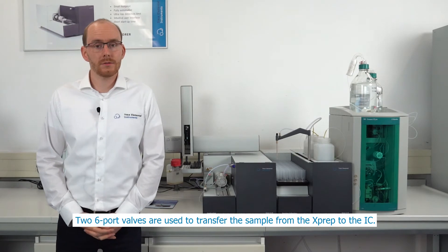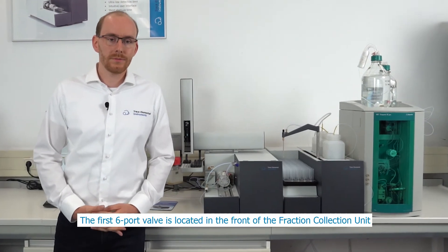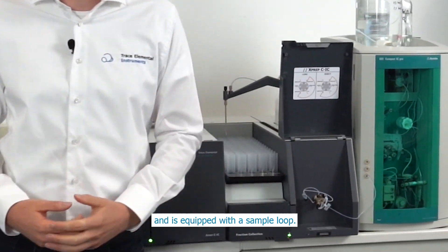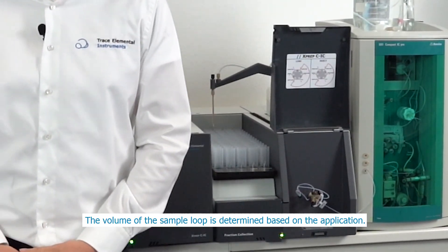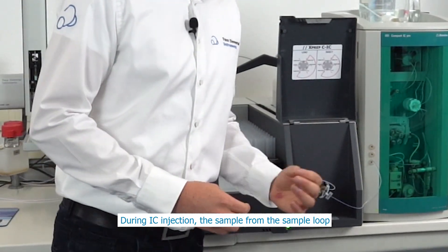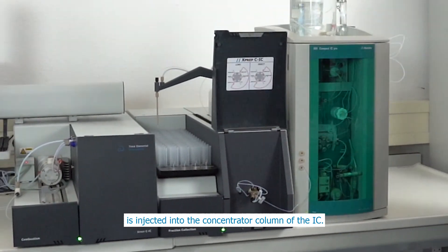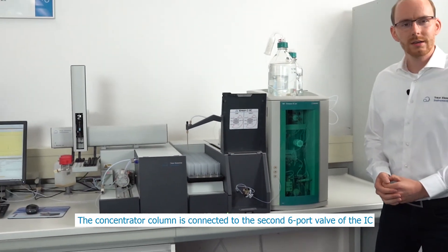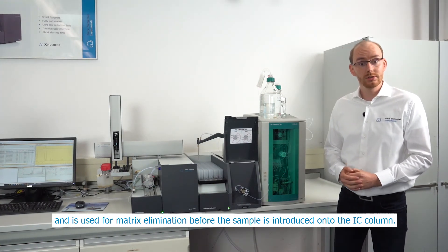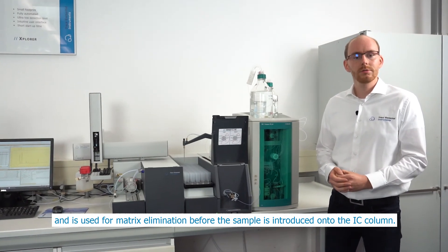Two six-port valves are used to transfer the sample from the X-PREP to the IC. The first six-port valve is located in the front of the fraction collection unit and is equipped with the sample loop. The volume of the sample loop is determined based on the application. During IC injection, the sample from the sample loop is injected into the concentrator column of the IC. The concentrator column is connected to the six-port valve of the IC and is used for matrix elimination before the sample is introduced onto the IC column.